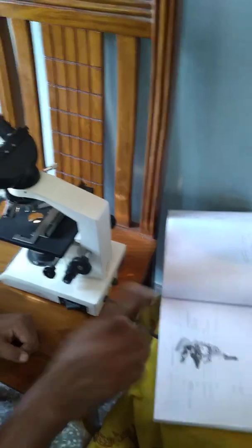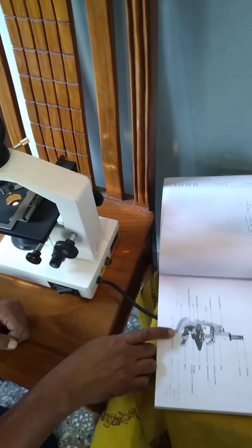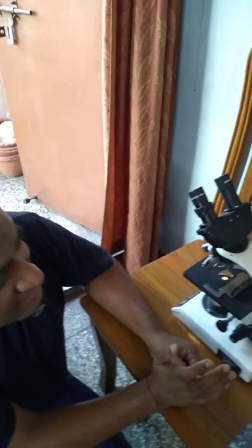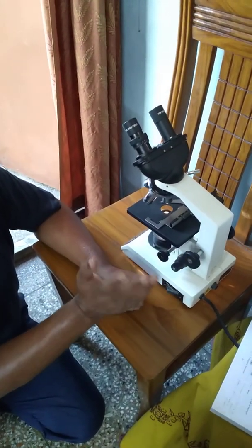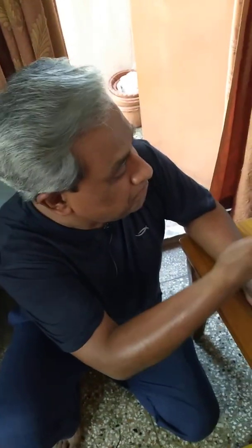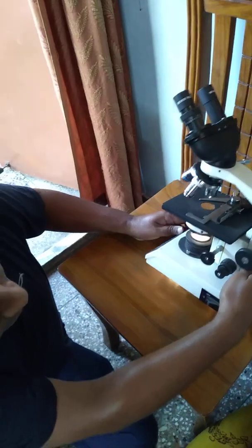You can see and read about the uniocular microscope in the other YouTube segments. I will be detailing the stages and the magnification and all those details that are needed in our experimental physiology. What is important is that I will tilt this one and show you.